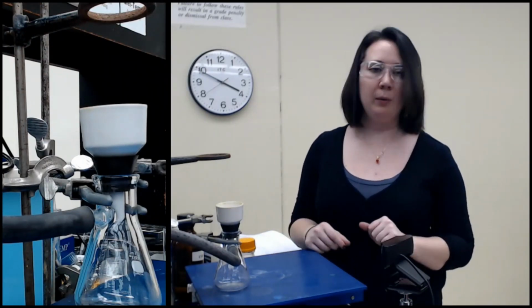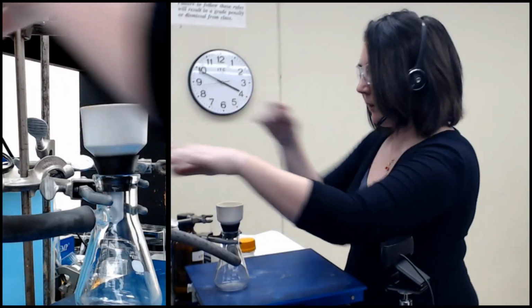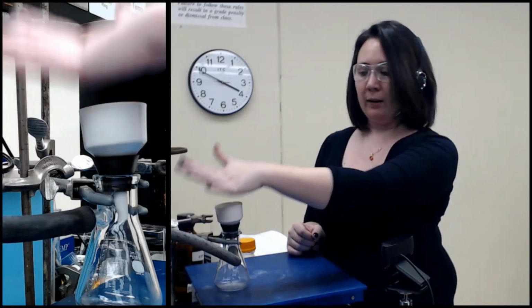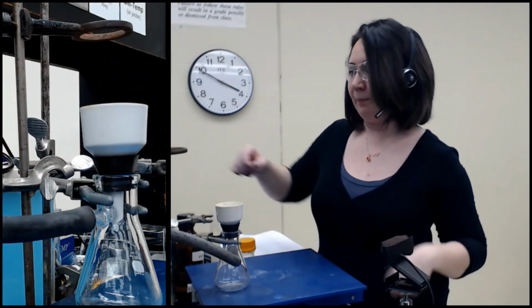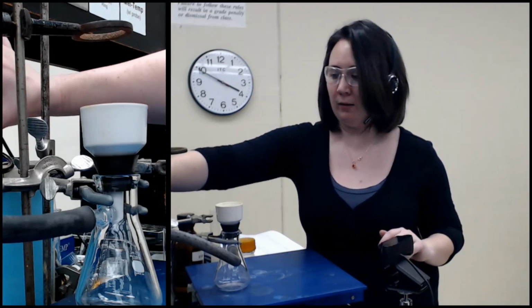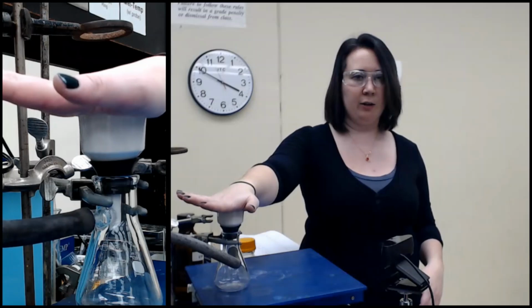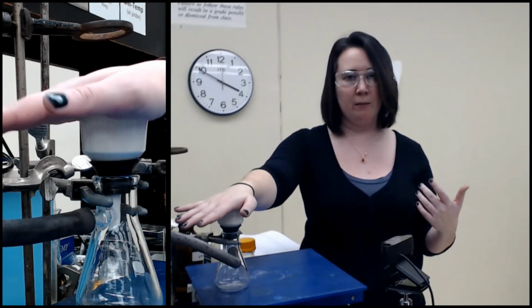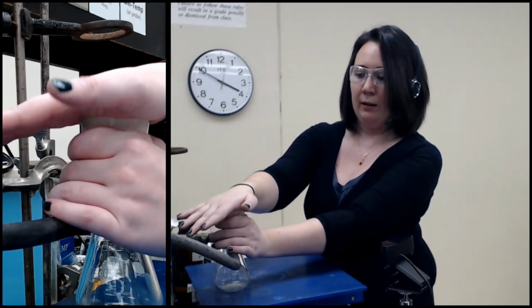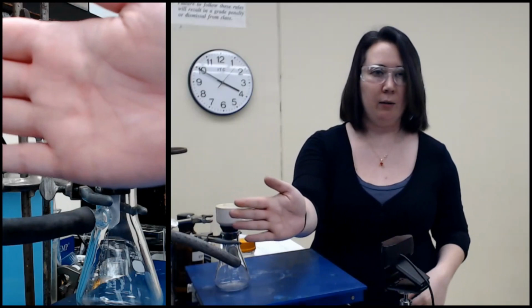And then we want to check that the pump is working before we start pouring anything in here, because once we pour in here, it's a lot more work to switch to a different setup. So I'm going to turn the pump on, and check that I have a nice strong pull from the vacuum. You can hear the change perhaps, but more importantly, you can feel it pretty well. You can see the outline where it was.